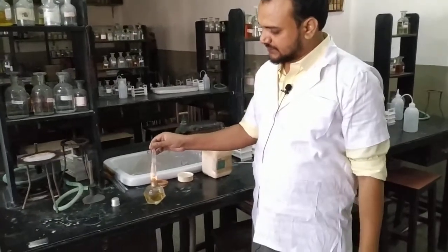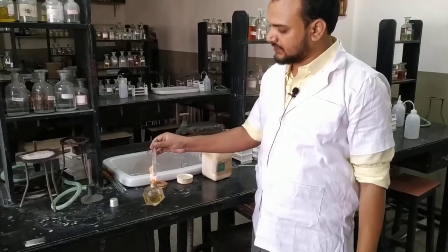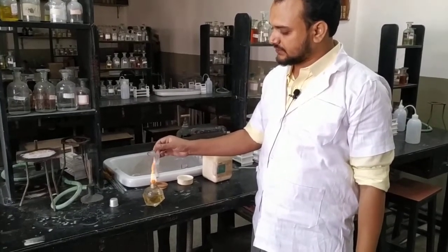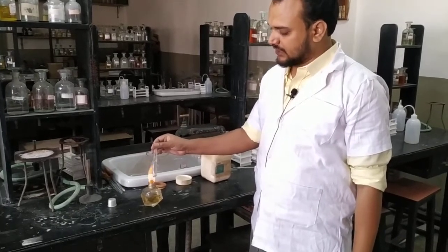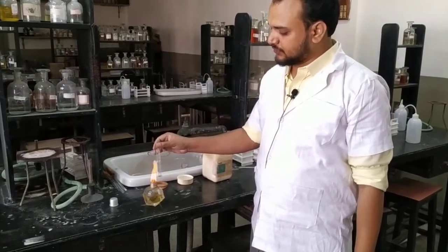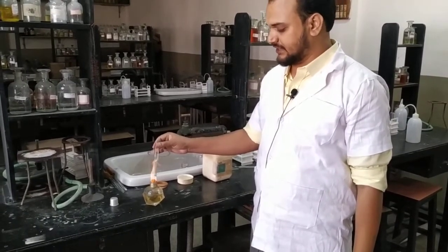Now, for neutral FeCl3 — you know FeCl3, ferric chloride salt, is the combination of ferric hydroxide and HCl, hydrochloric acid. Hydrochloric acid is a very strong acid and Fe(OH)3 is a weak base, so the aqueous solution of FeCl3 is acidic in nature. We need neutral FeCl3.